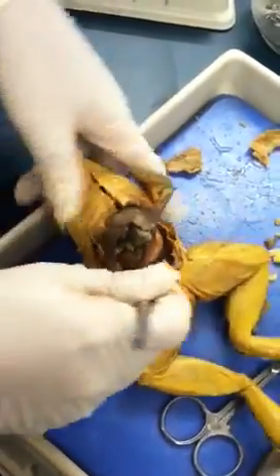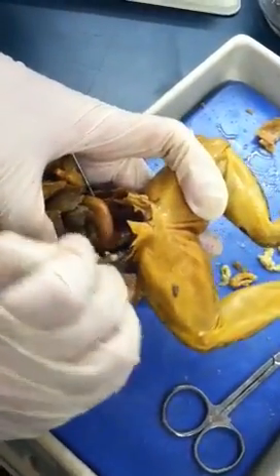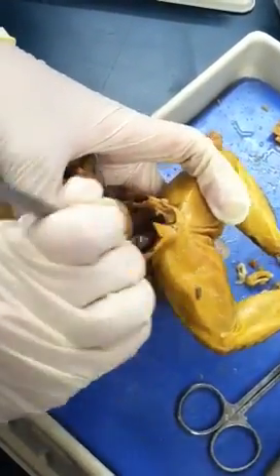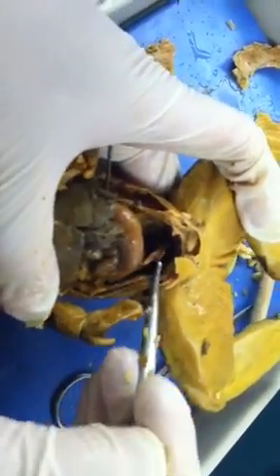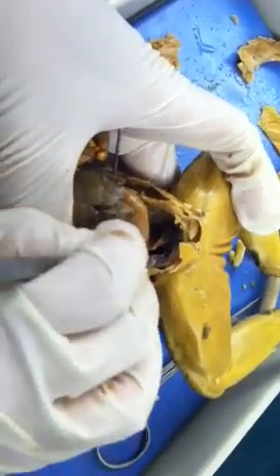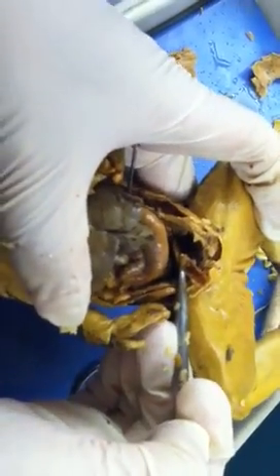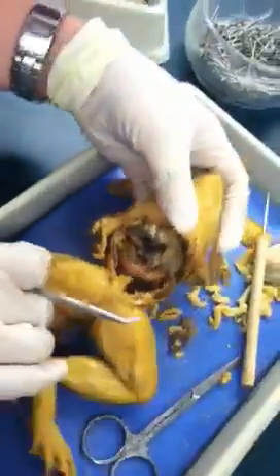If he asks about the sac in the lower region, he's asking about the urinary bladder. This one on the bottom — it's like a pouch, and it's empty now because there's no urine in it. So if a sac is pulled out from the bottom like this, that's the urinary bladder.